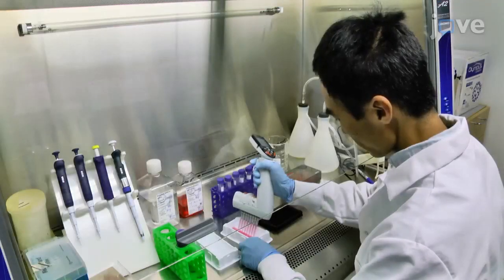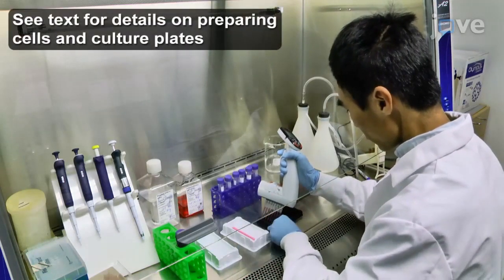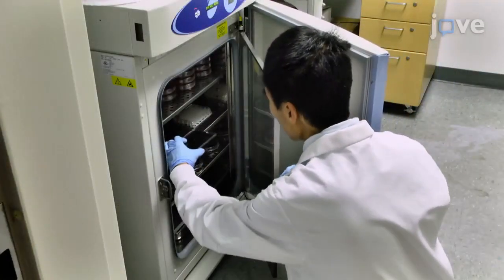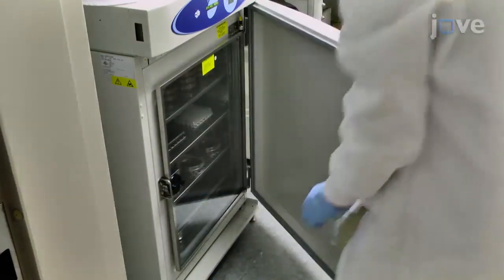To begin, seed 5,000 cells per well into a black wall, clear bottom, polylysine treated 384 well plate. Incubate the plate at 37 degrees Celsius with 5% CO2 for 3 hours for the cells to attach to the bottom of the plate.